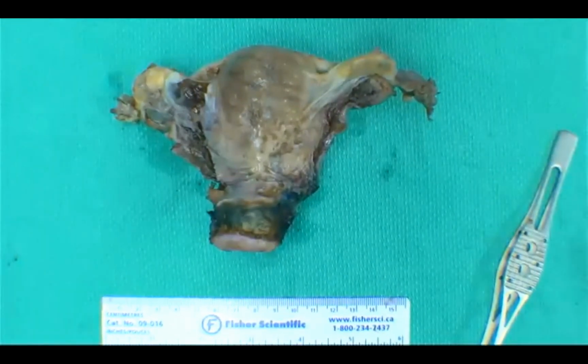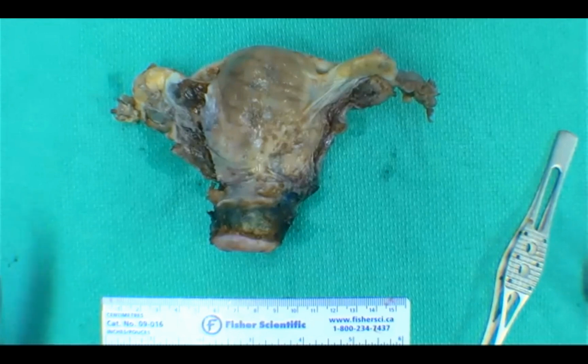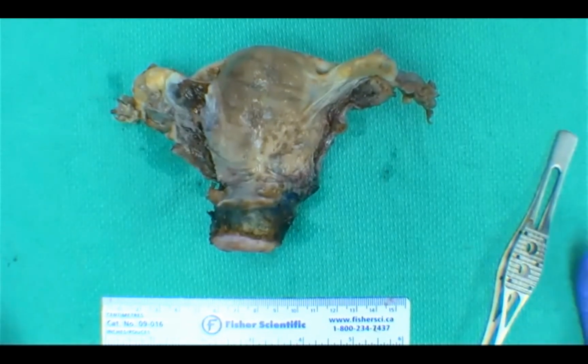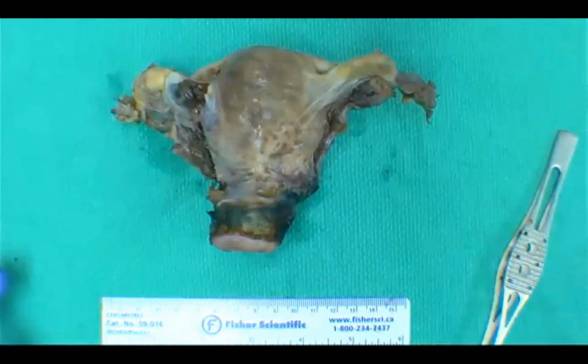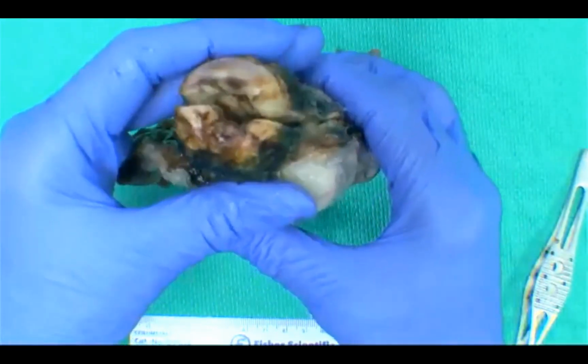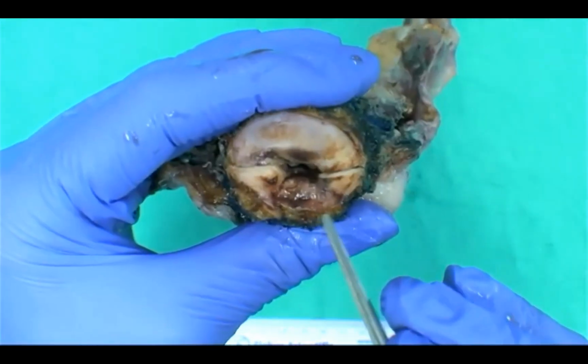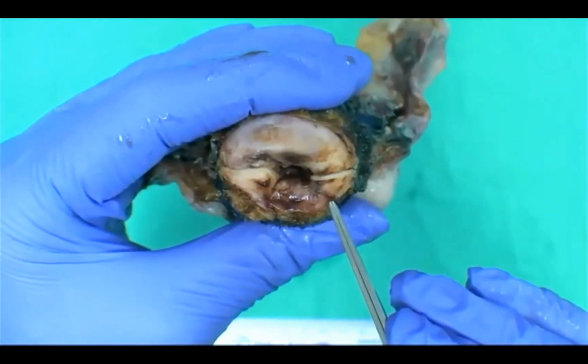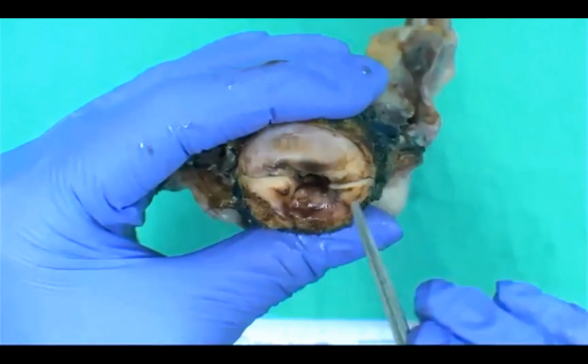The thing about gynae pathology is it can be very subtle. And this is when history becomes really important. So it's always important to check all your history, past biopsies. We're going to come back and focus on the cervix a little bit more. We can see that there is this area here that is really congested and it looks a little bit ragged.